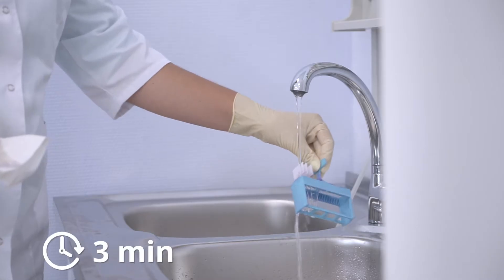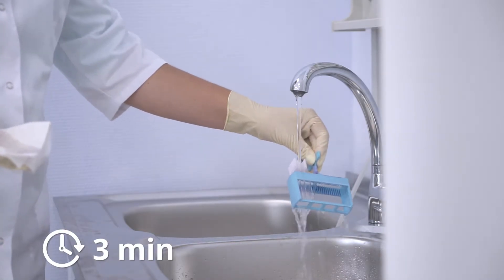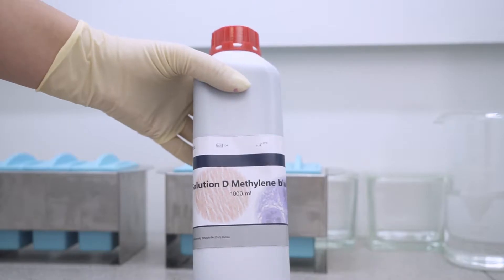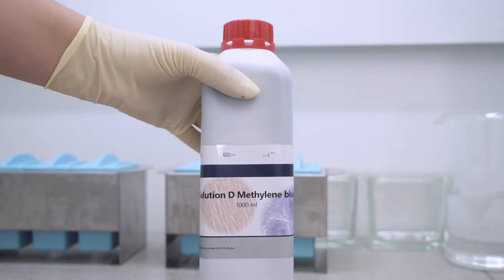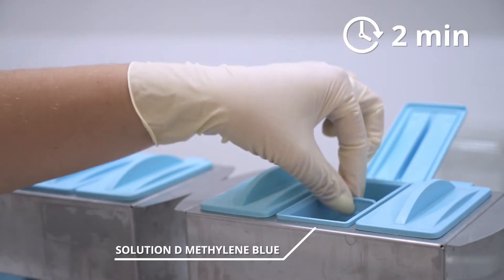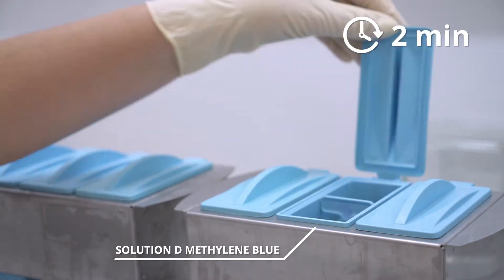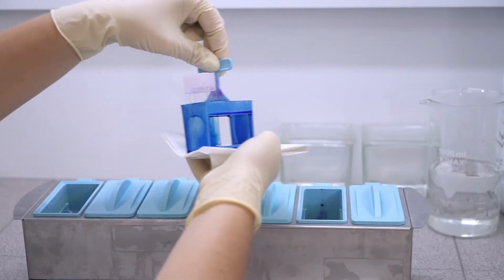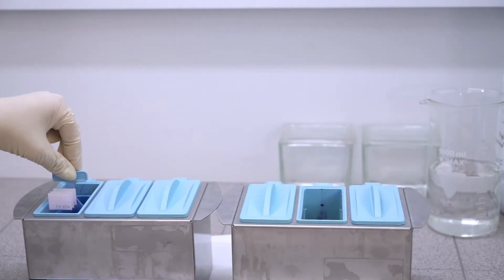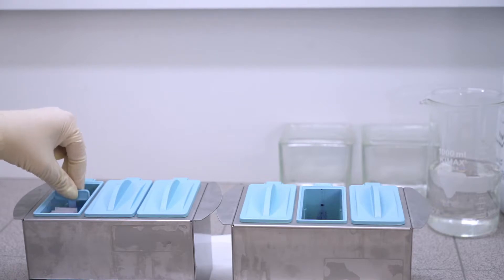After that we wash slides under the running water for 3 minutes. Then we put slides in reagent D for 2 minutes. After that we wash slides firstly in distilled water and then under the running water for 5 minutes.